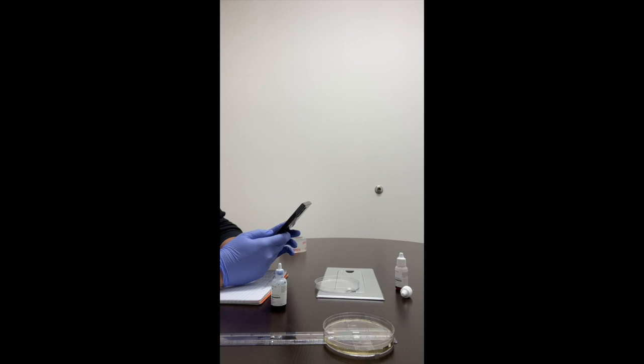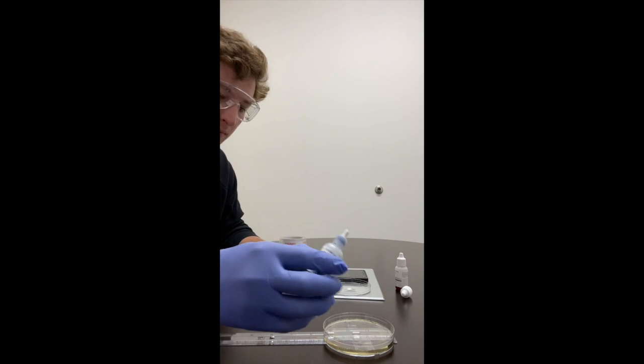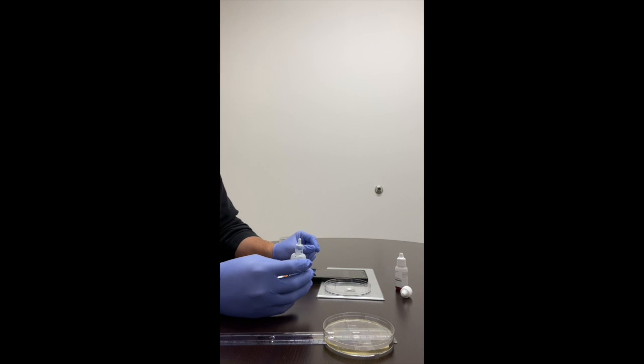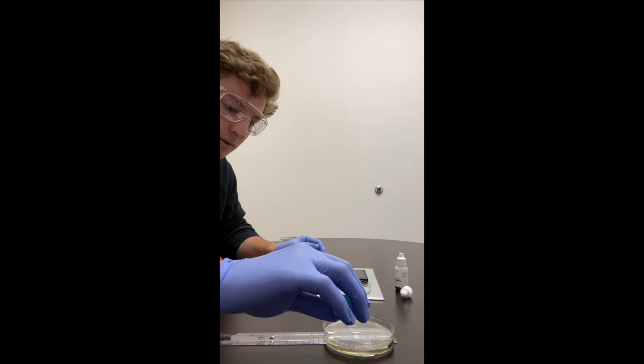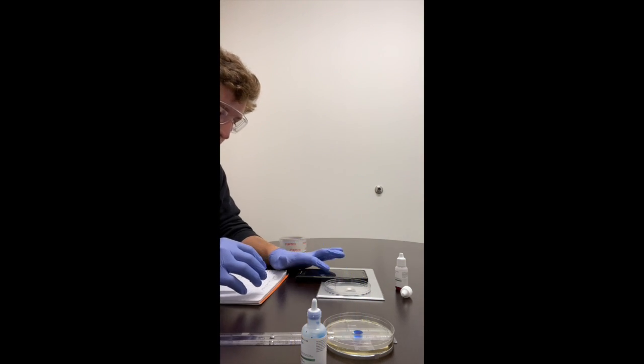Record your data. Okay. So we're going to place a drop in the middle, and start the timer.